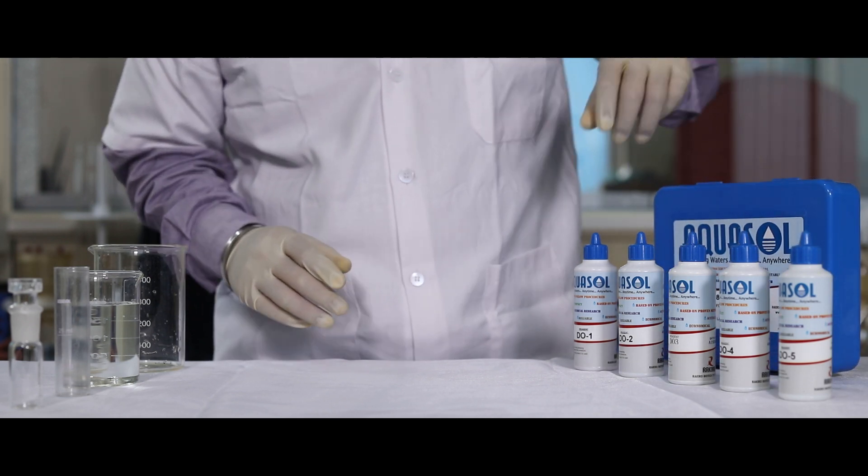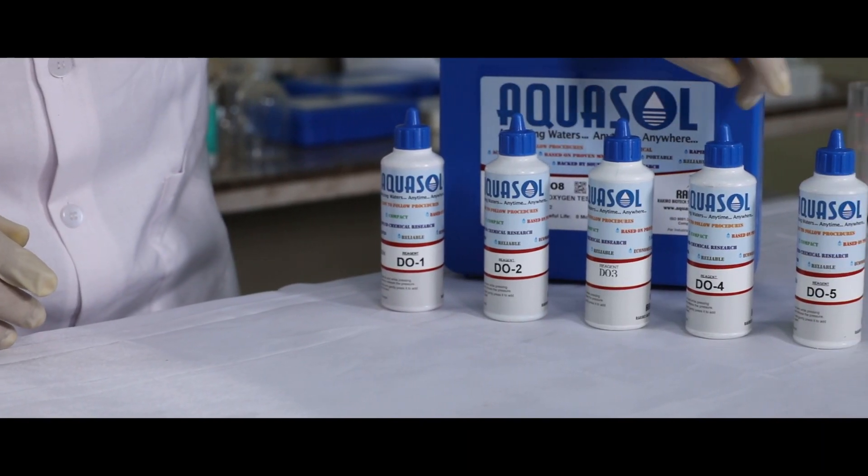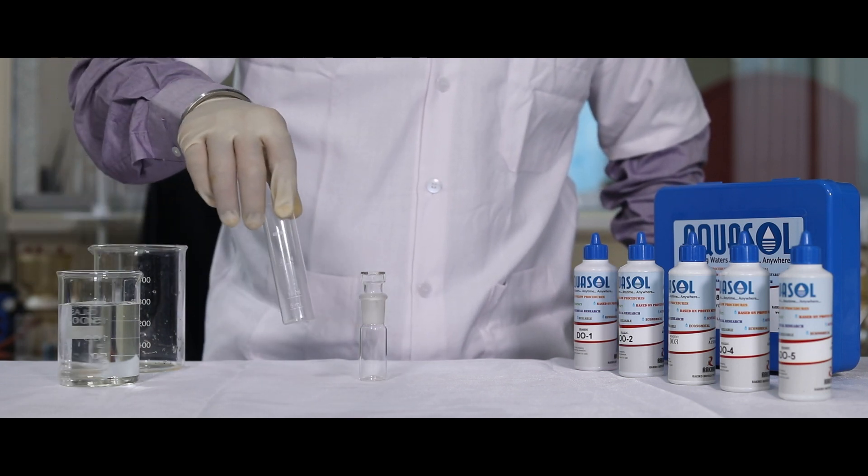This kit contains 5 DO reagents along with a DO bottle and test jar.